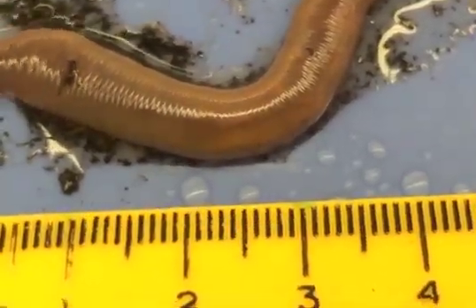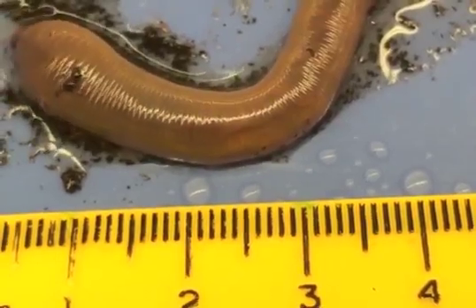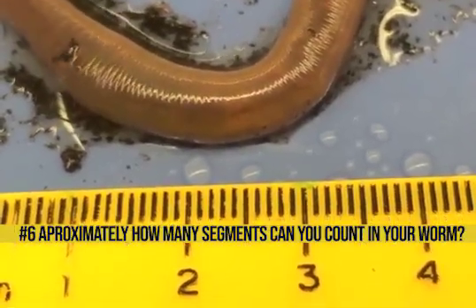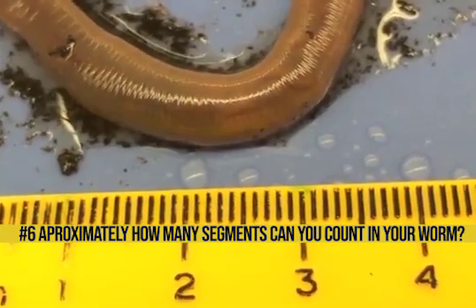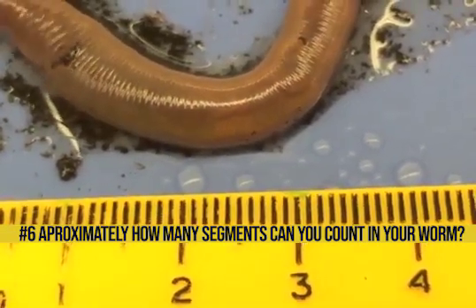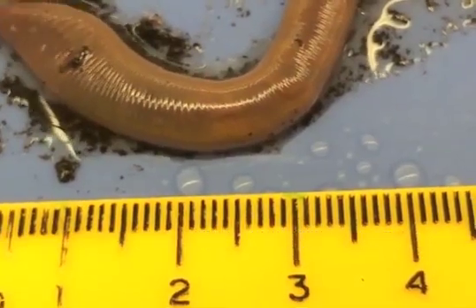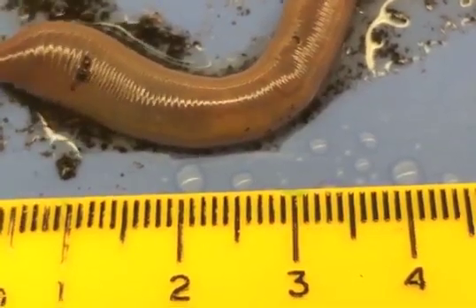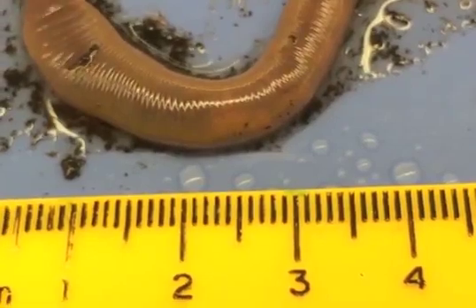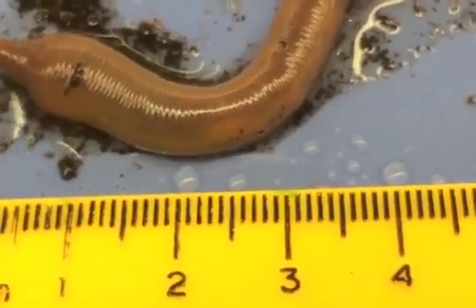Alright, so we are going to count the number of segments in your worm. What you need to do is count how many segments are between two centimeters to three centimeters, and you multiply by the total length of the worm. That will give you the total segment count. Record it in number six in your data table one.